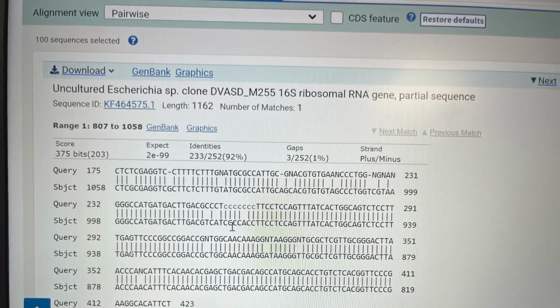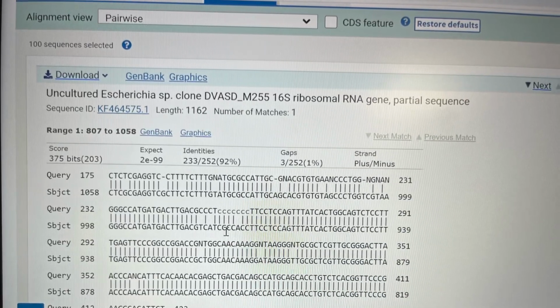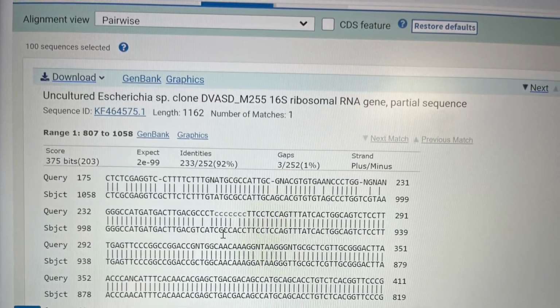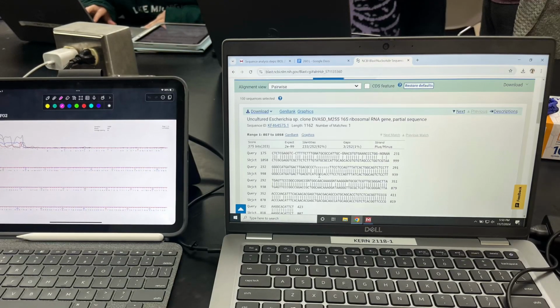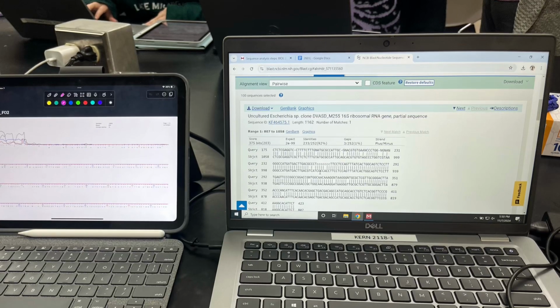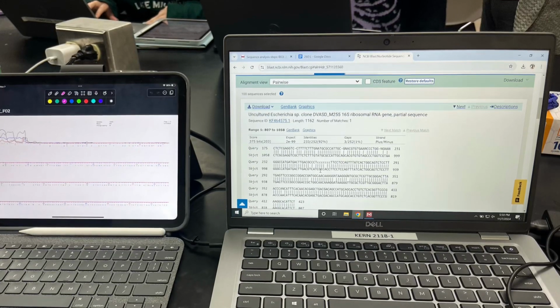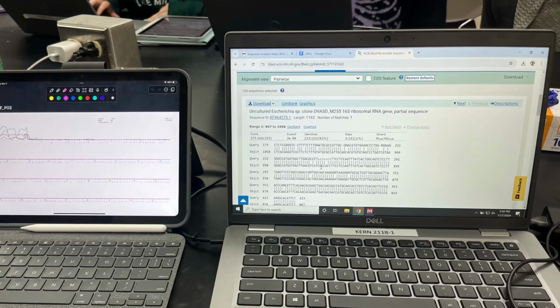Then click the MUSCLE alignment tool at the top of your alignment window to align your sequence. After that, you should see your forward start on the left and reverse start on the far right. After that, hopefully there are a few hundred base pairs in the middle where they overlap, and if not, you need to get rid of some of the sections that don't overlap very well and realign them.